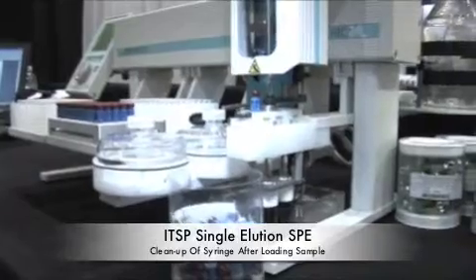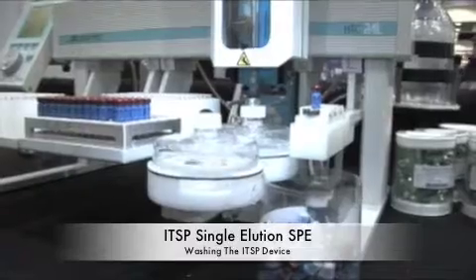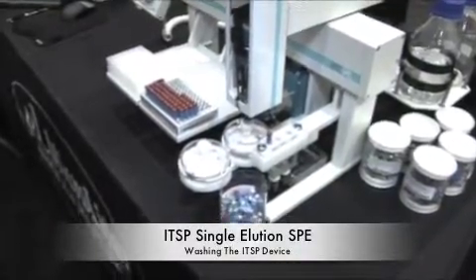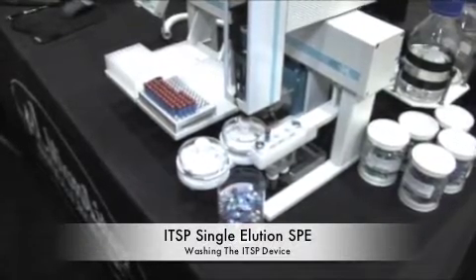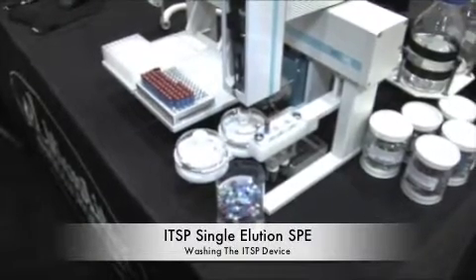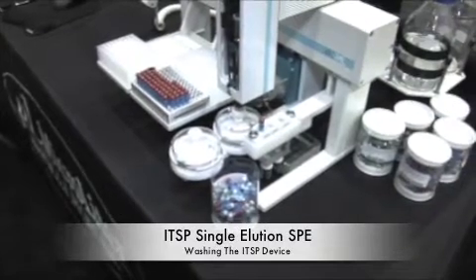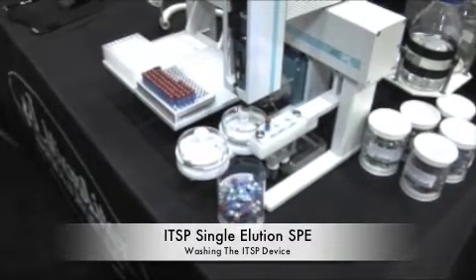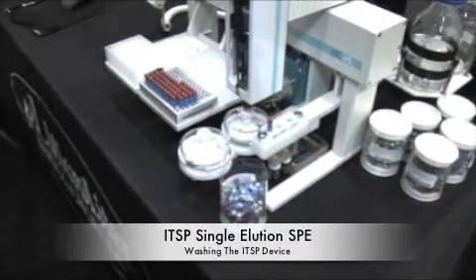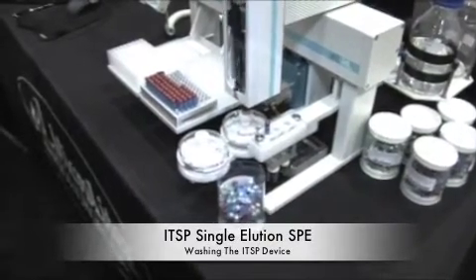ITSP is extremely useful for methods that are required just in time. You can do a variety of methods. It's controlled by the PAL software, and then we integrate that into your system as well. We will help you by providing you with raw devices that you can use manually, and then we will write the automation and come to your lab to show you the demo, and you can actually run samples during the demo to replicate your manual method that we've transferred.